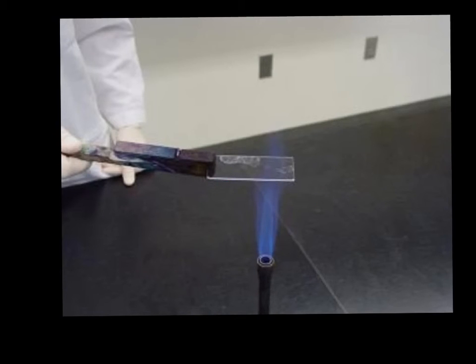We're not going to move it too slowly so that we become uncomfortable, the heat starts to hurt our hand. We also do not want to overheat the slide where we cause the slide to crack or break. Once we've done this, we have denatured the bacteria protein, in essence killing the bacteria and sticking it to the slide.